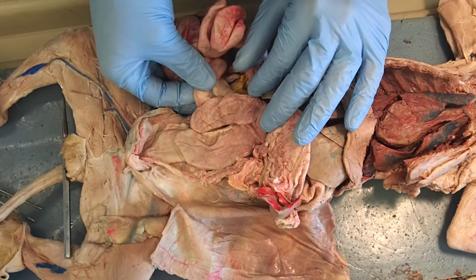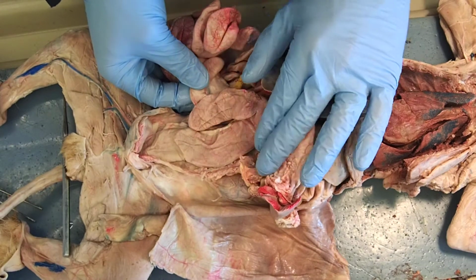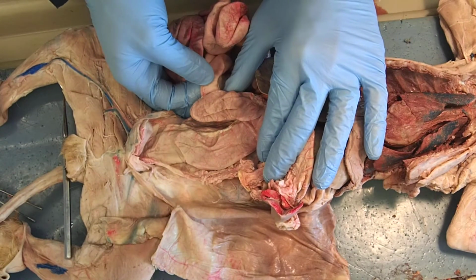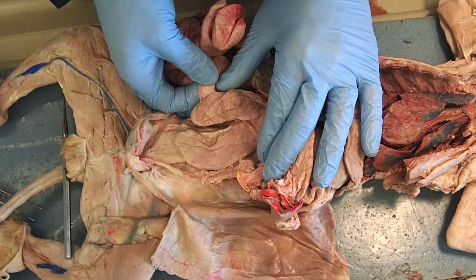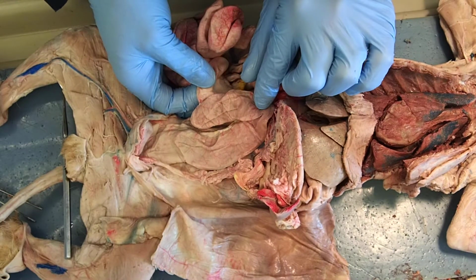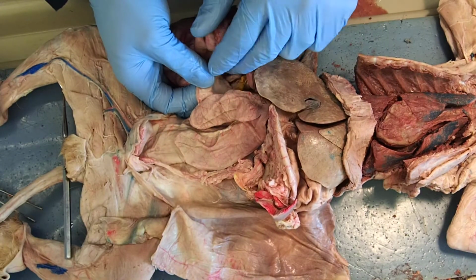Small intestine just prior to going into the large intestine, the ascending colon. You can see how much smaller it is in diameter between my fingers. This between my fingers would be the ileum. This is the last section of the small intestine. Then it's going to pass into the ascending colon, transverse colon, descending colon.